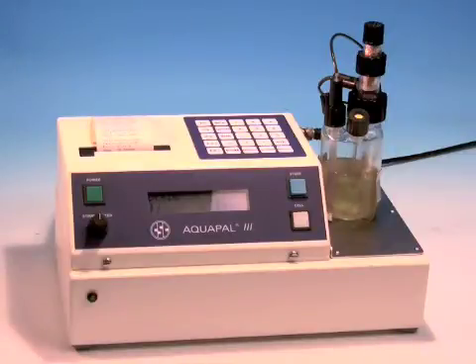This new water standard oil by Sigma Aldrich is different in that it's so new there's really no standard error. It hasn't been used that much, but what they've done is they've taken lots of oil that they used for the standard, they've tested it, and here's the results that we get.